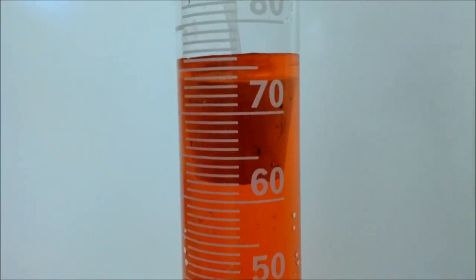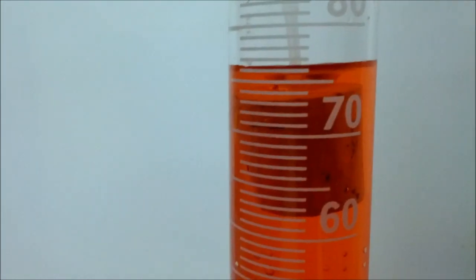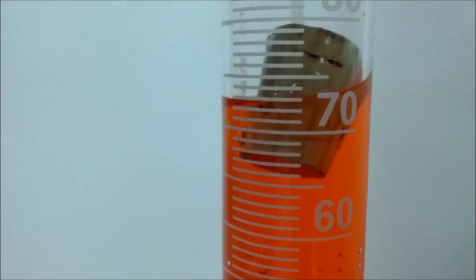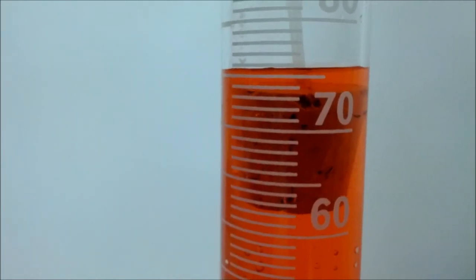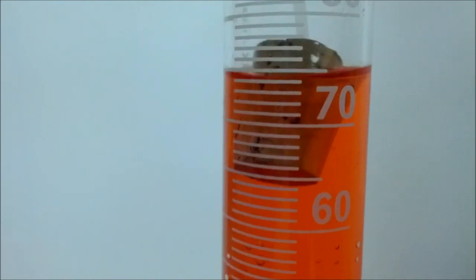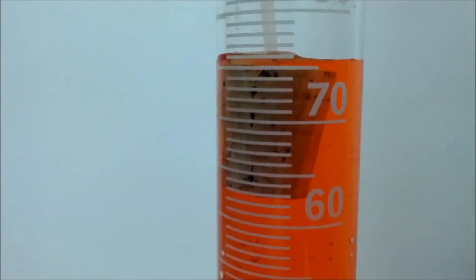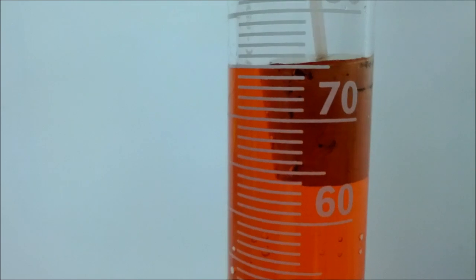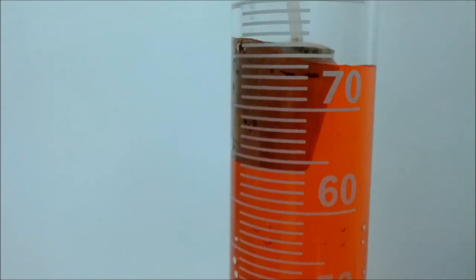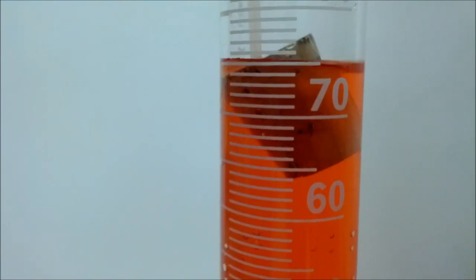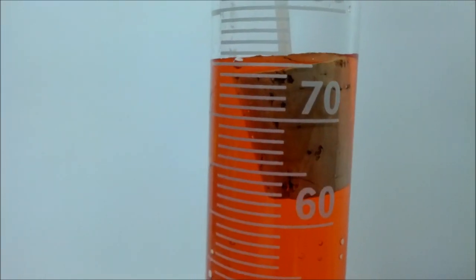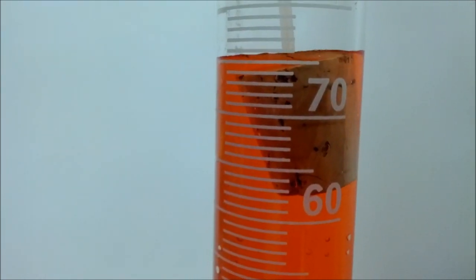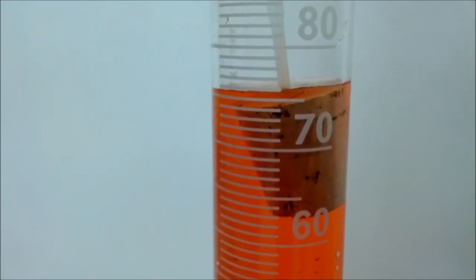Okay, so she's going to push it down, and right when it's just under the water, now we're going to take a measurement. You kind of have to put it just right under the water. Bring it up just a tiny bit. It's hard to do. Okay, I'll go with that. So I'm going to say the bottom of our meniscus right there is at 75.